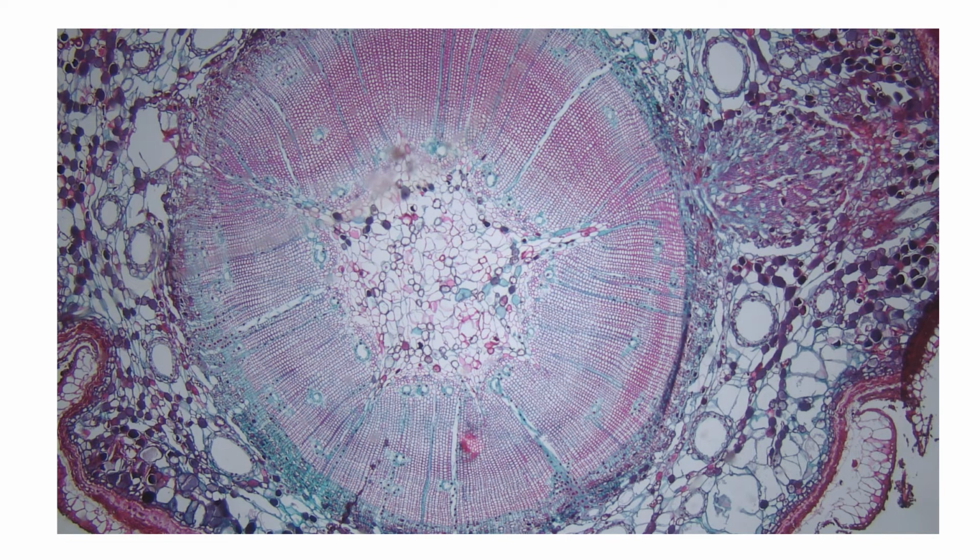So here is our slide. Hopefully you saw something pretty similar to this. And I remember talking to some, and there was some initial confusion of what exactly am I looking at here? Because you know what? I kind of get it. If you look at it though, it looks kind of cool, like a nice little painting of some kind. I don't think it's that bad. I don't know if I'd hang it up and put it on my wall. So maybe the bathroom or something. Hey look, this is a cool plant tissue. And now that I'm looking at it, it does kind of look like a weird eye. We have this big center point with the colorful part around it. I don't know if you can see my mouse, but a colored part. So it's like a plant eye staring at you. It's a tad unnerving. So let's re-nerve this sucker.